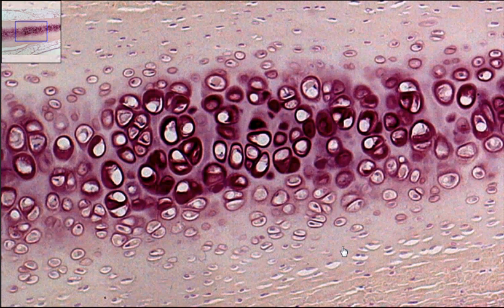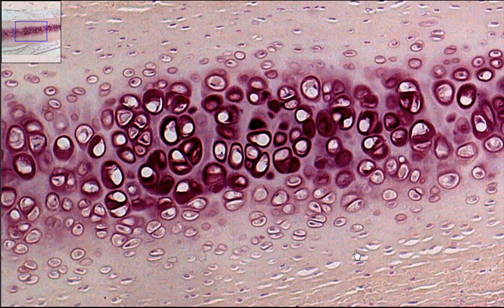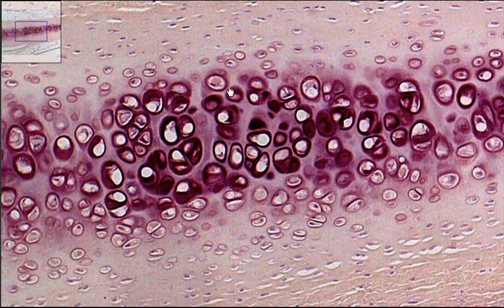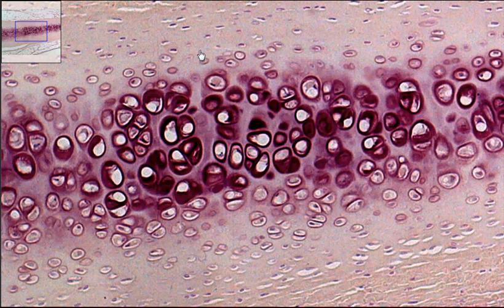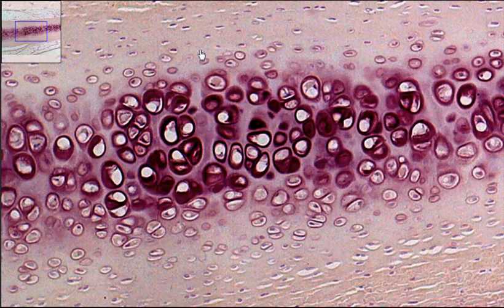So we have all three features that distinguish connective tissue. This is your hyaline cartilage: chondrocytes inside lacuna with the extracellular matrix. It's a gel-like matrix, and the fibers are inside of that.